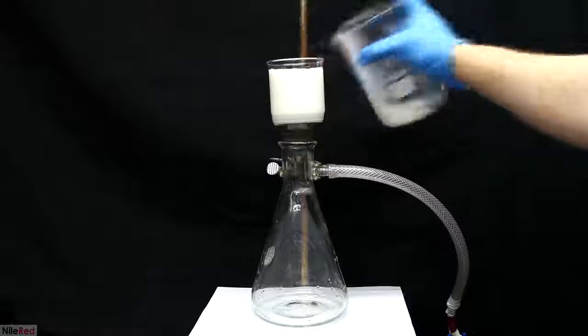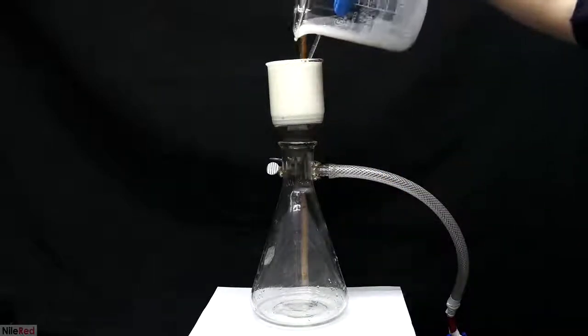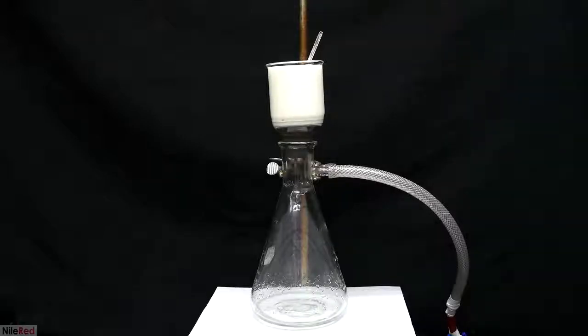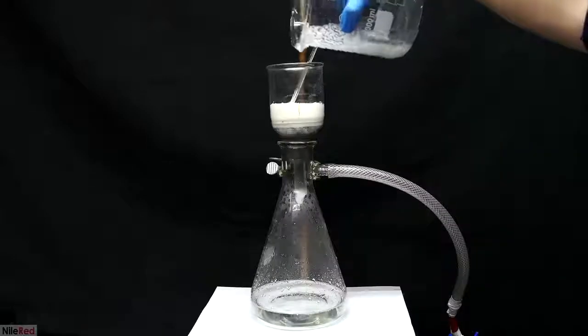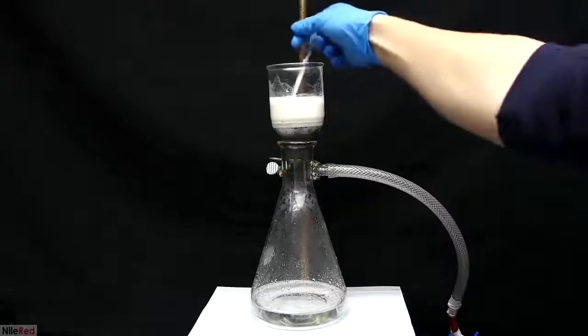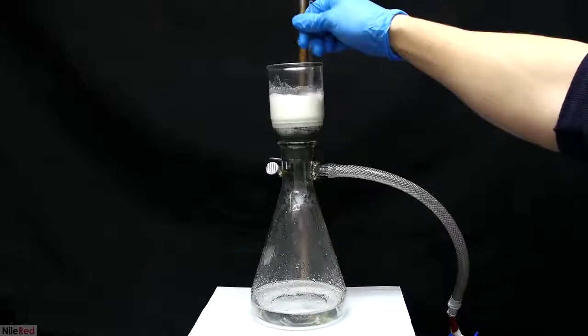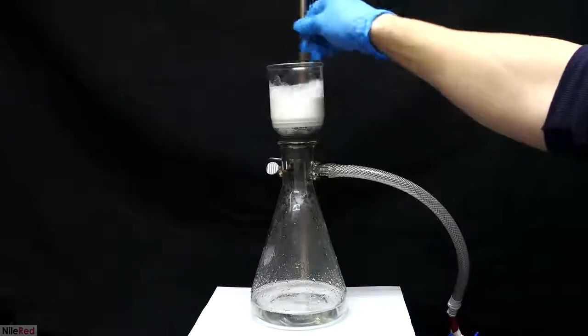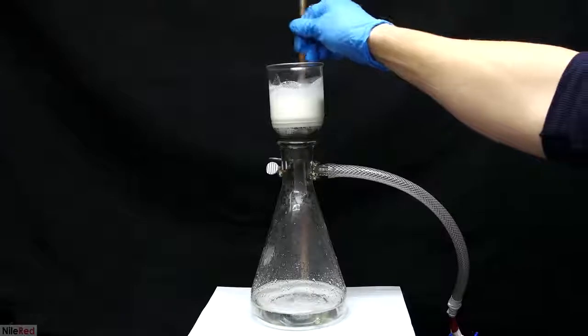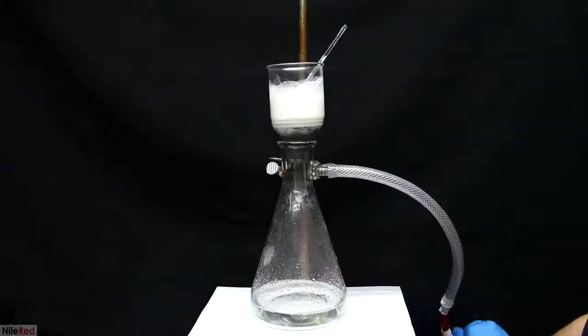I again went back to my trusty vacuum filter and I separated off the calcium sulfate. Even with the vacuum on full, the filtering process is kind of slow. Once everything comes through though, I use a little bit of water to wash the beaker and then I add it to the filter. Using the stir rod, I mix things around to give the calcium sulfate a good wash. There might be some citric acid trapped in the calcium sulfate, and this can help to pull it out.